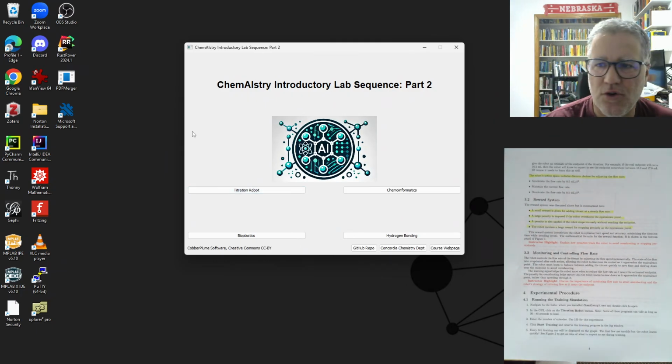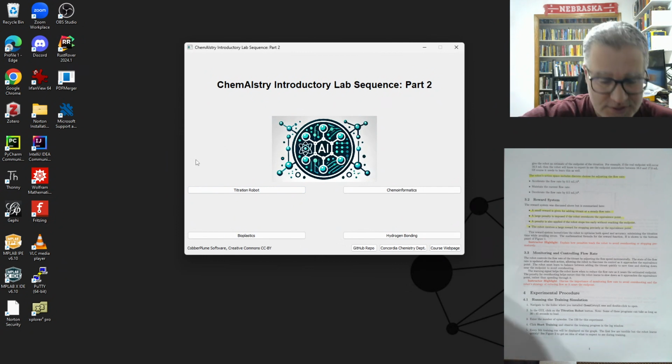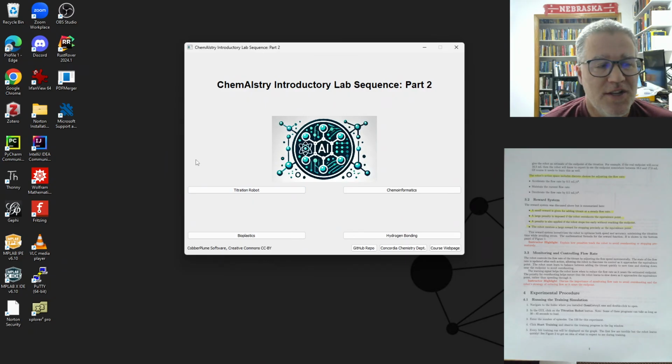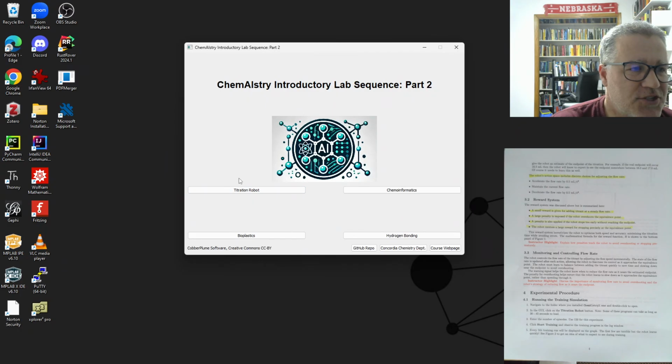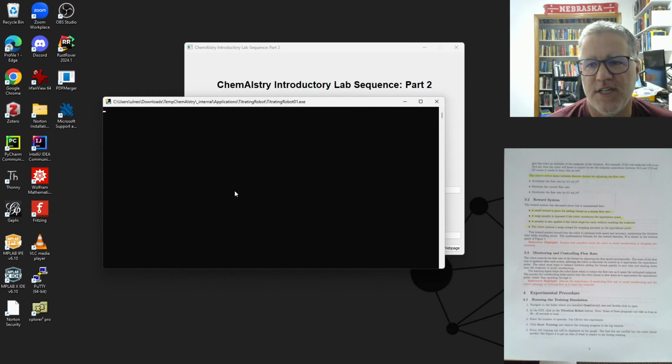All right, well, let's go run the experiment. And this is what's quite nice, but sometimes not nice about this: it's every time it's different. So the last time when I practiced this, just before this video, it was perfect. It illustrated all the good points. So hopefully that'll happen again for us. But let's go ahead and try this, and you will get something that behaves differently than what I get or what you're seeing on my machine.